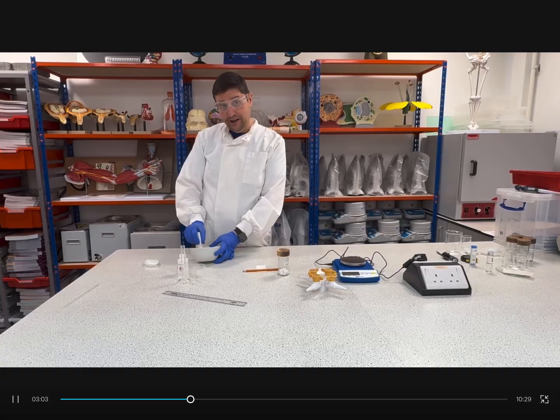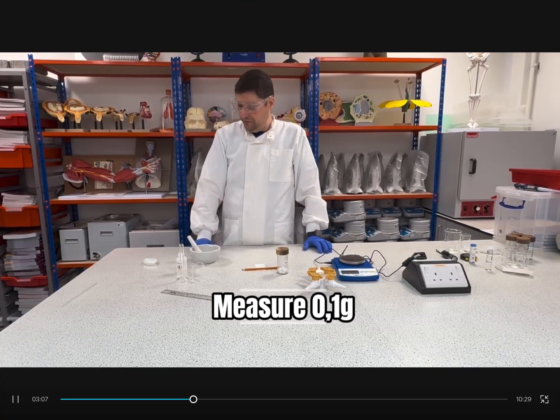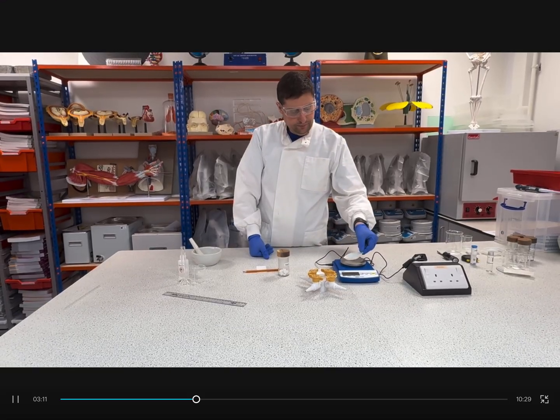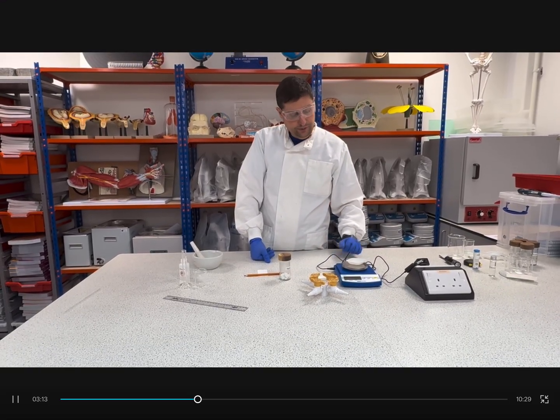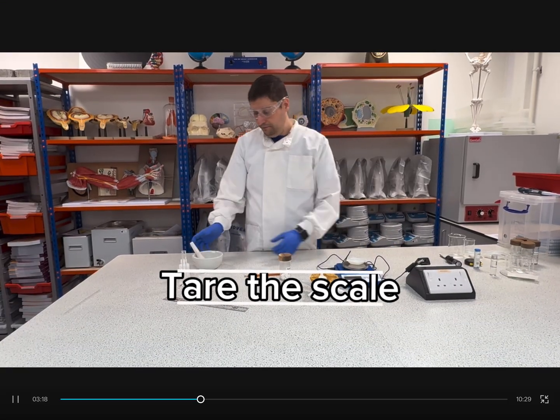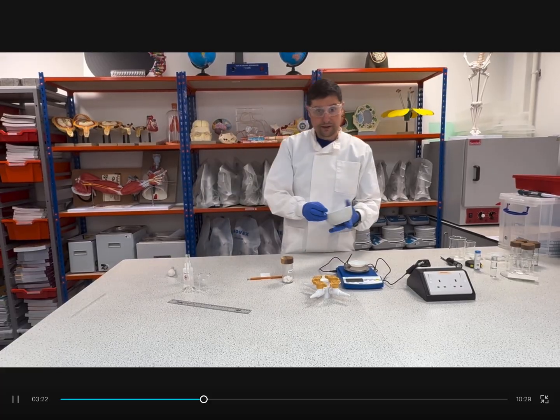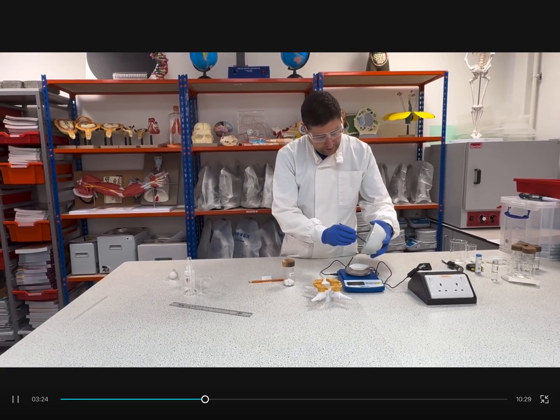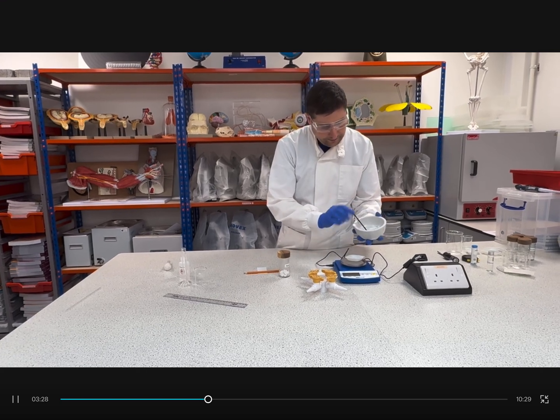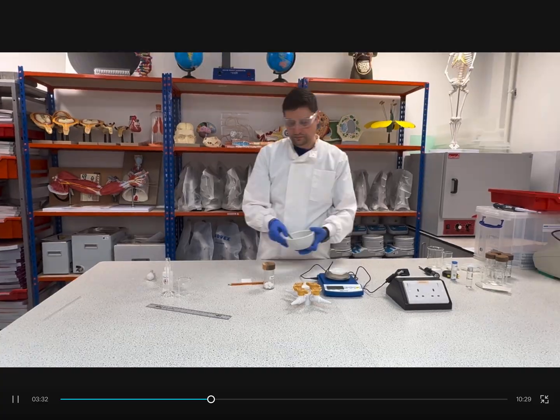So after I grind it, I need to weigh 0.1 grams. So I will take my weighing boat, place it on the top of the scale, and press tare. Then, using my paintbrush, slowly I will transfer 0.1 grams.